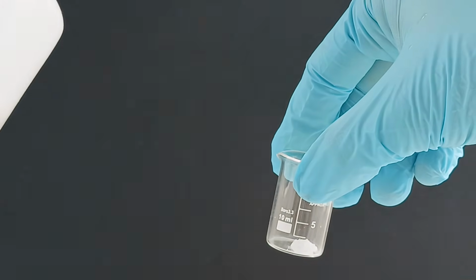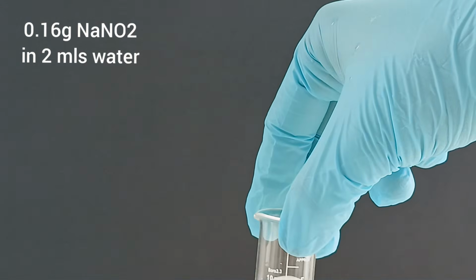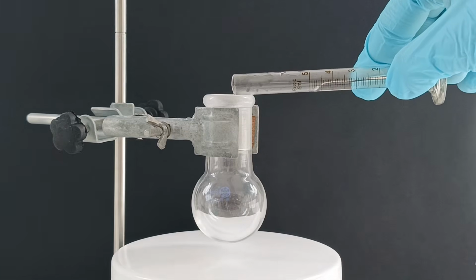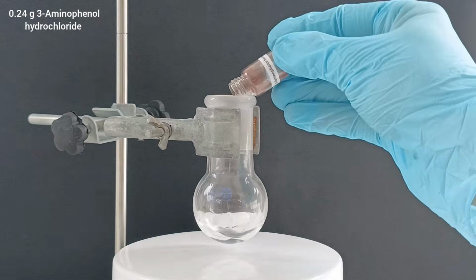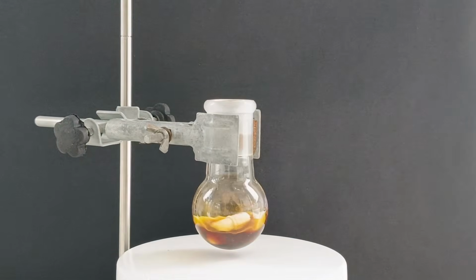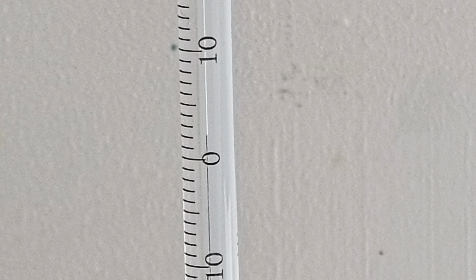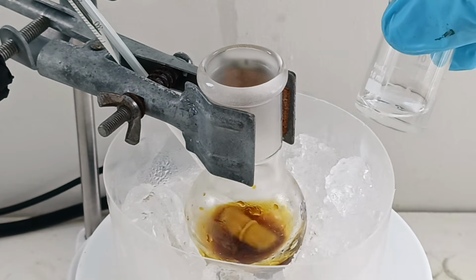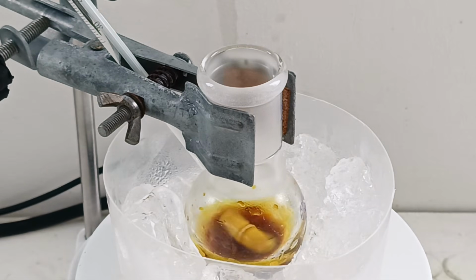Alright, so let's begin. First I dissolve 0.16 grams of sodium nitrite in 2 ml of water, and set the solution aside for later. Then I prepare a tiny round bottom flask and add 2 ml of 10% hydrochloric acid to it, followed by the 0.24 grams of 3-aminophenol hydrochloride from the last episode. Once dissolved, I set up an ice bath and thermometer and cool down the solution to between 0 and 5 degrees Celsius. The sodium nitrite solution from earlier is added dropwise to the cold acid solution using a pipette. I allow the mixture to stir for 10 minutes in the ice bath.